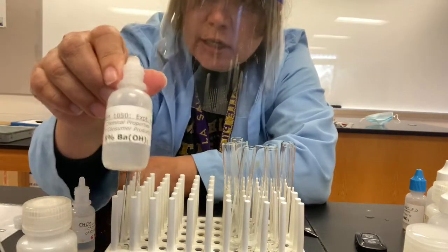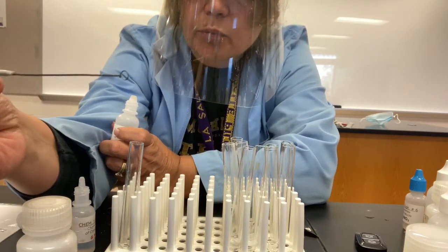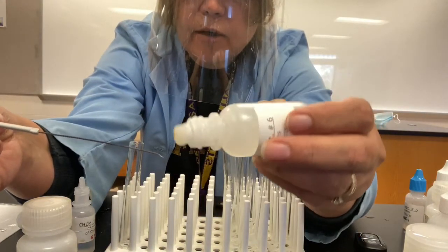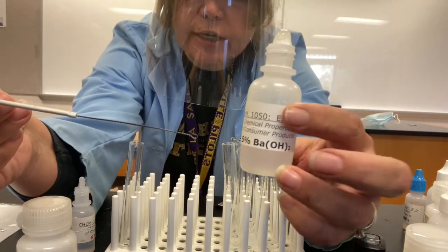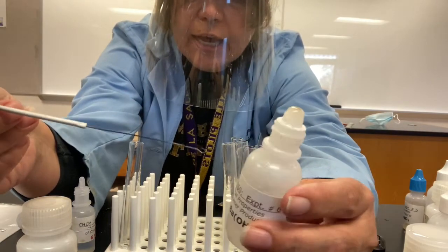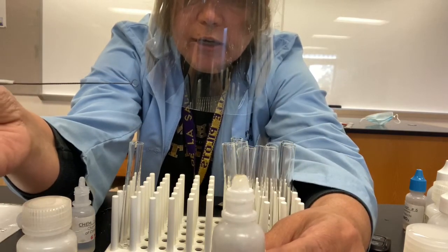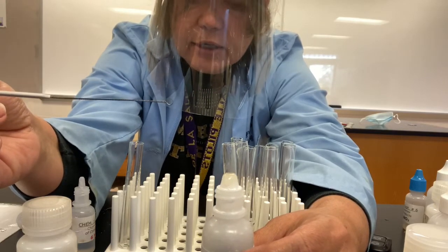So the barium hydroxide solution will be placed on a wire loop. See the little end, that loop on the little end? I'm going to put some on that tip. And then when the barium hydroxide encounters some carbon dioxide, the carbon dioxide, when it gets into the water, forms some carbonate ion. And the carbonate ion will react with the barium ion to produce solid barium carbonate. And we should see then the loop turn to a white color in the presence of the solid barium carbonate.